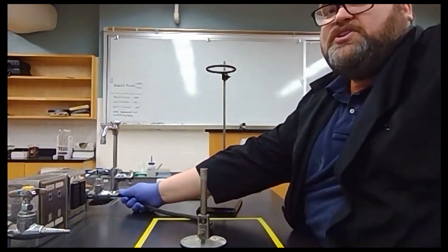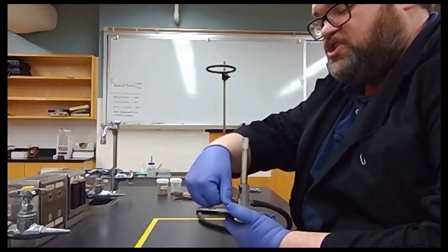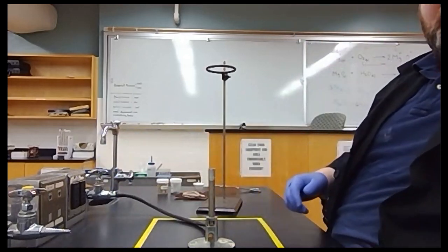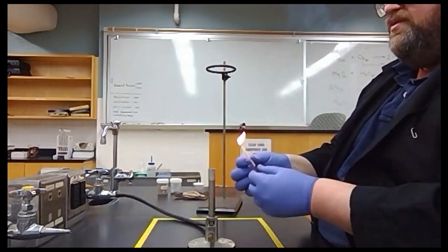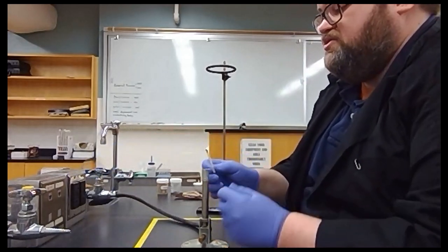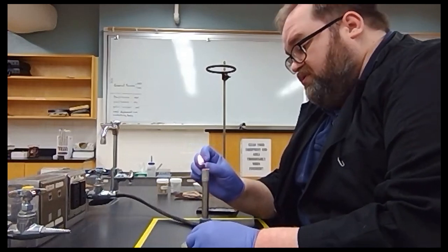Next, we're going to take our Bunsen burner, and remember, for safety, we always completely close our Bunsen burner whenever we first get it. Then we turn it 2 big turns on both the bell and the gas inlet. Then we attach it to the gas main. At that point, we're ready to start trying to light the fire. So remember, we strike our match and hold it just off to the side and turn on the gas with gusto. Don't be afraid of the gas, okay? As long as you're standing back, you're going to be fine. Then we're going to begin doing adjustments until our flame is a stable 2 blue cones.